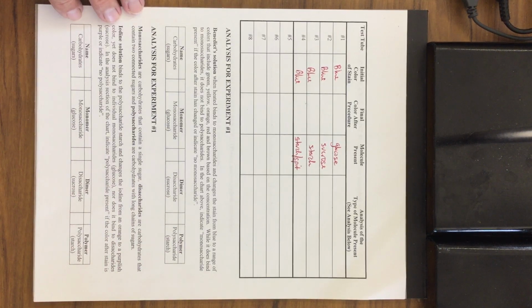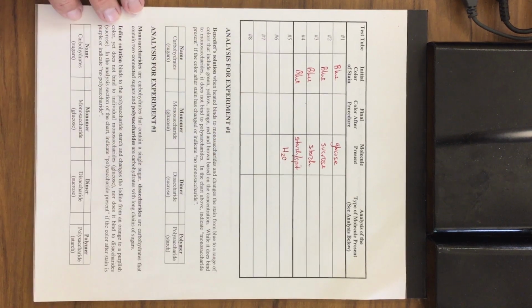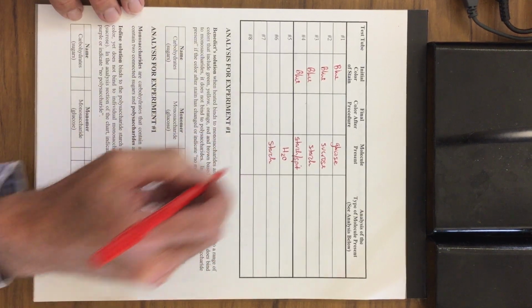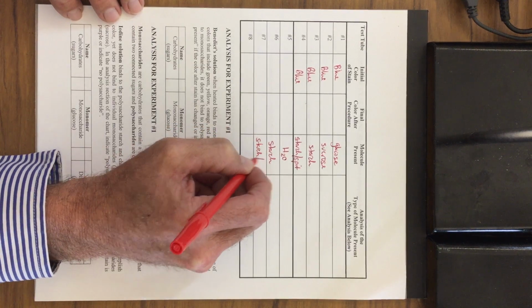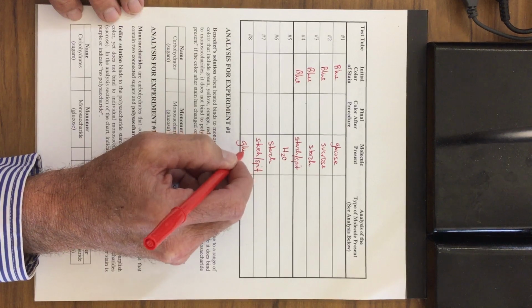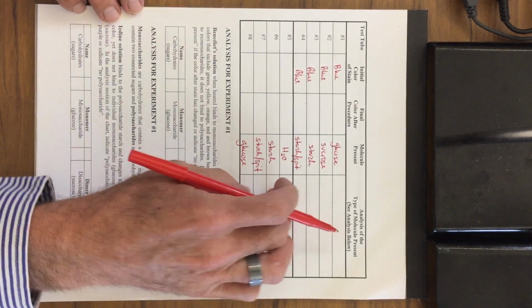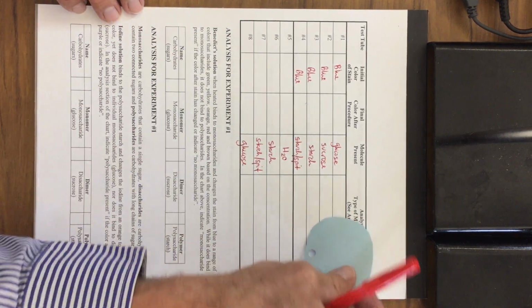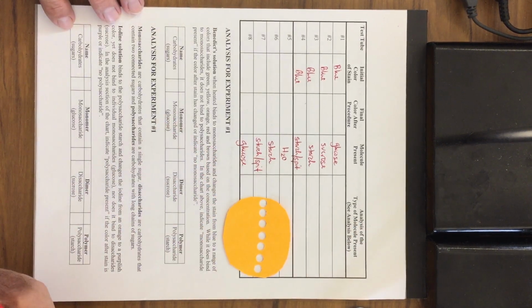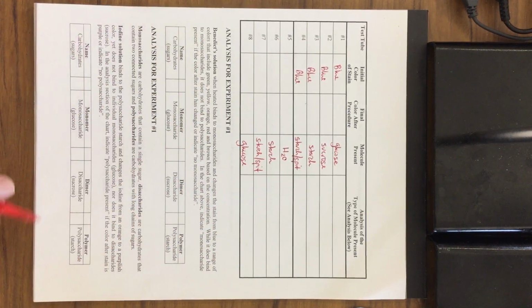Second experiment with the iodine. Test number 5, we had water. Number 6 had starch. 7 had starch and spit. And 8 had glucose. So it's a very similar experiment compared to the first. But again, here we're testing with the blue Benedict's to test for the monosaccharides, and here, the second one, we're testing with the iodine to test for the polysaccharides. So here's the analysis down below.